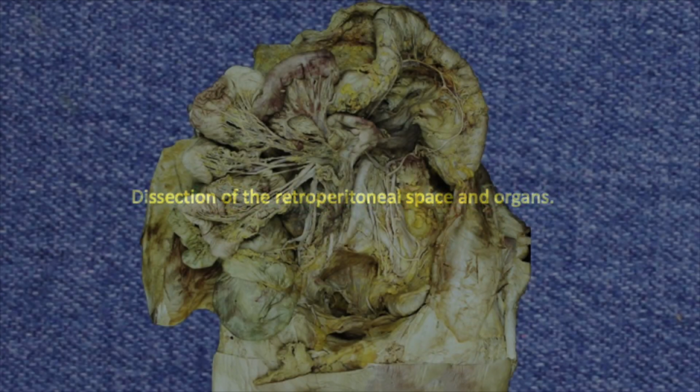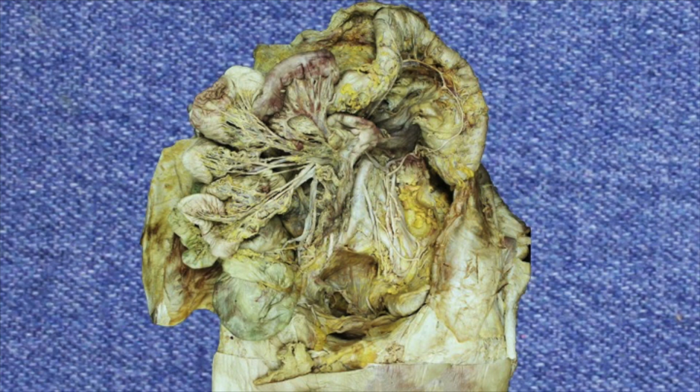Let's dissect the retroperitoneal space and its organs. Previously, we dissected the blood supply of the gastrointestinal tract from the lower esophagus to the sigmoid colon. The small and large intestines are relatively loose from their attachments to the posterior abdominal wall, and this is shown in the image.